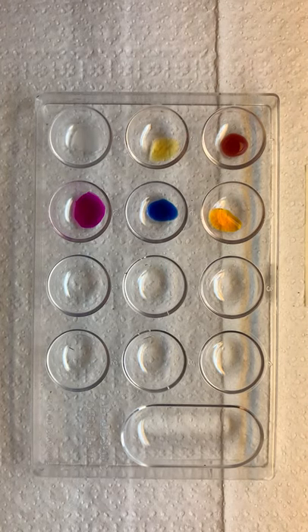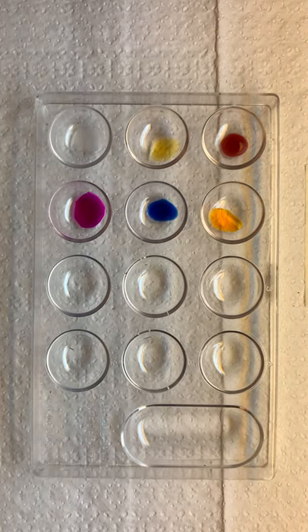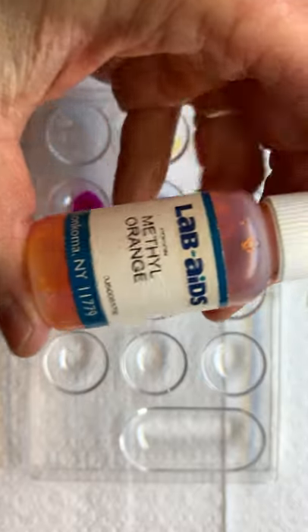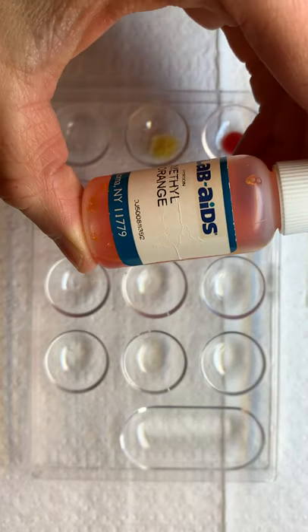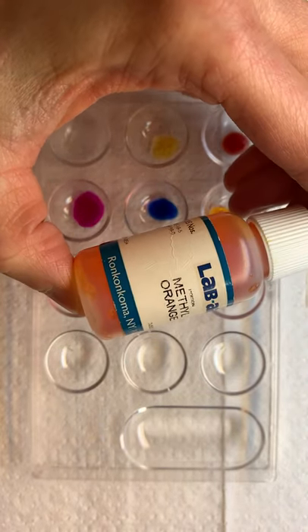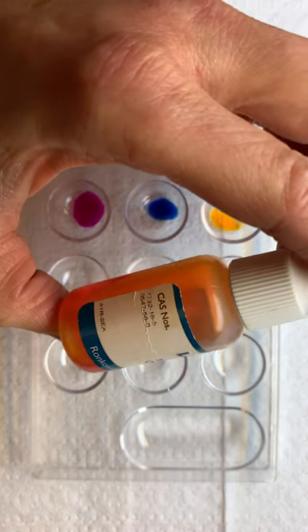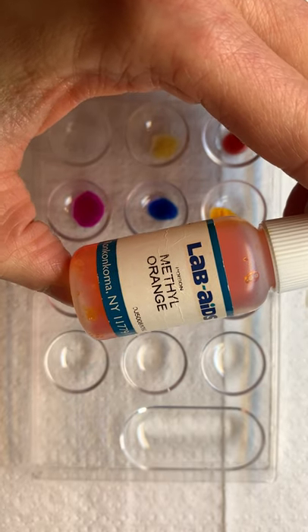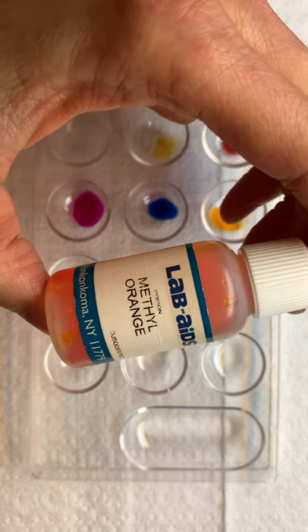Number one: the methyl orange solution. What color is the methyl orange solution? Well, it's orange — it tells you in the name. Methyl orange is orange.